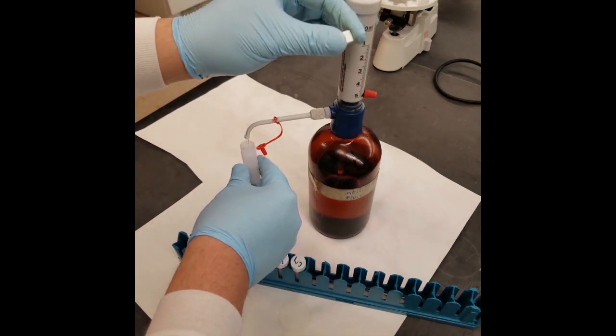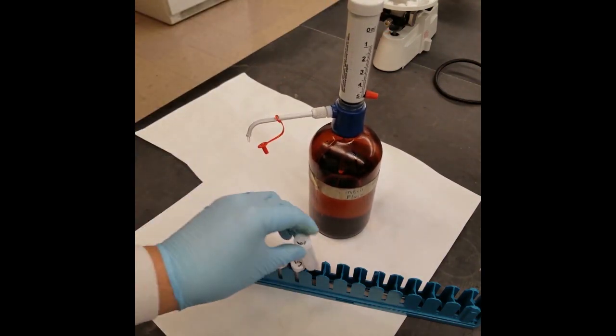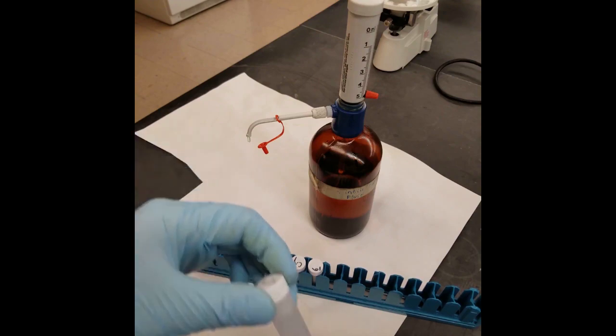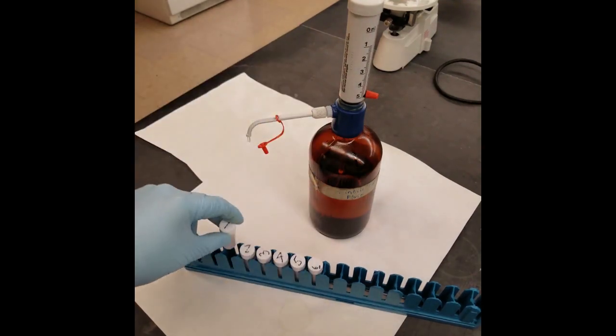Ensure that each vial is capped and secured and shake each tube to ensure that the filter paper is completely coated in the scintillation fluid.